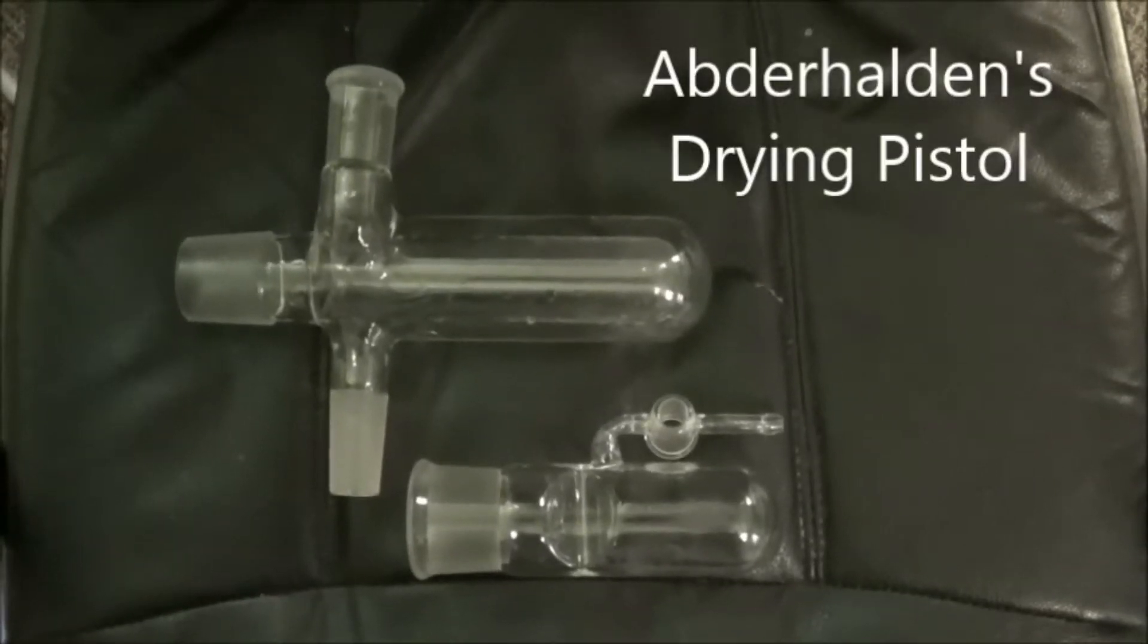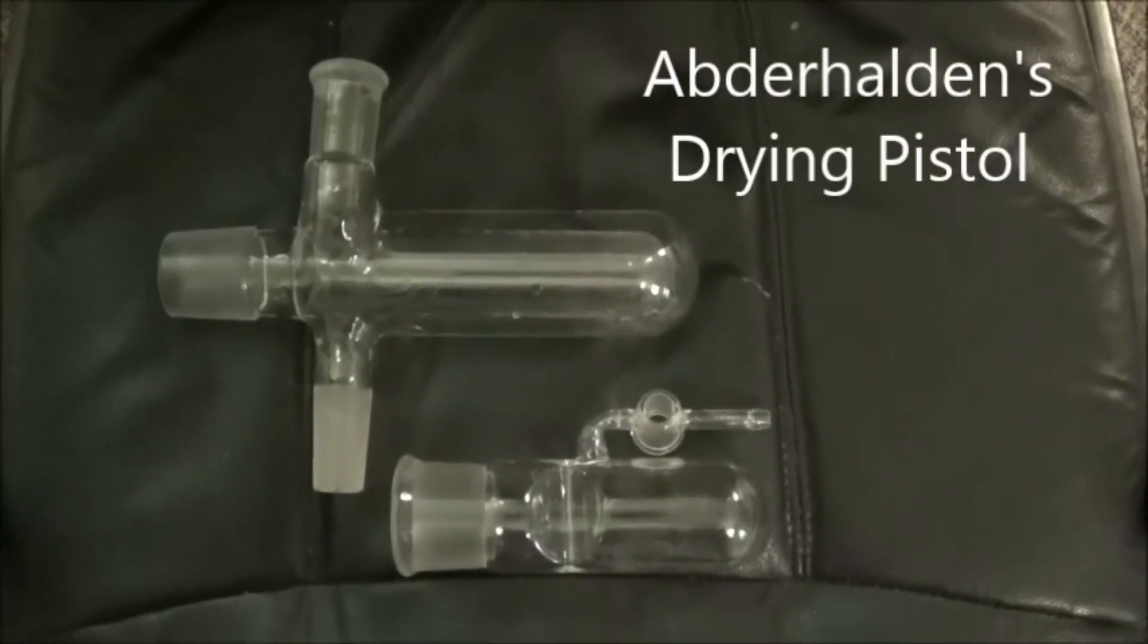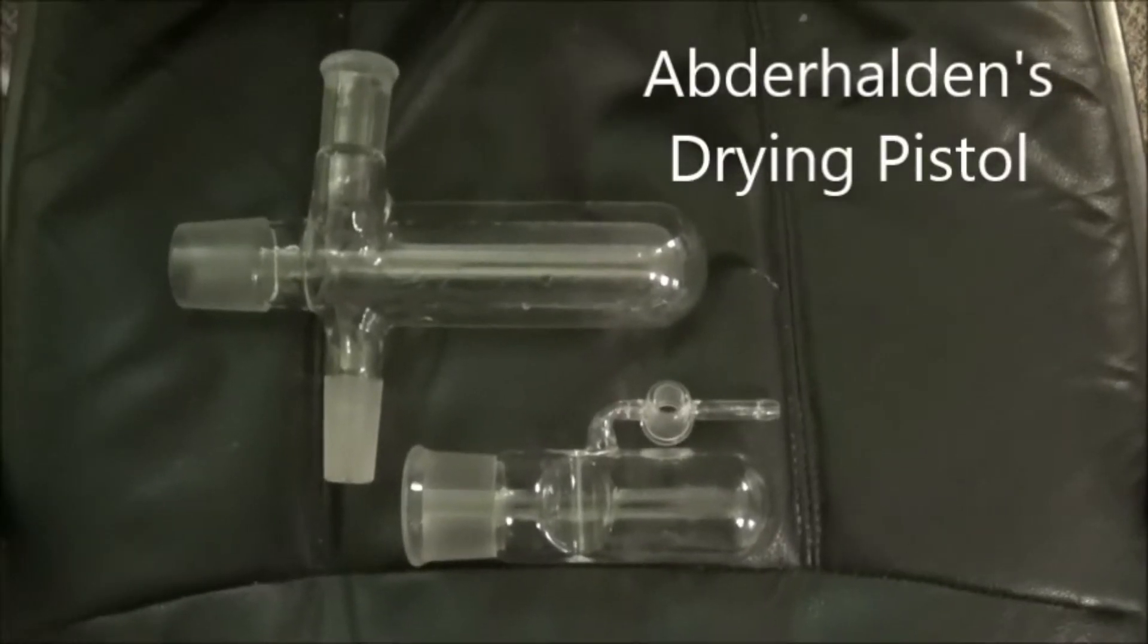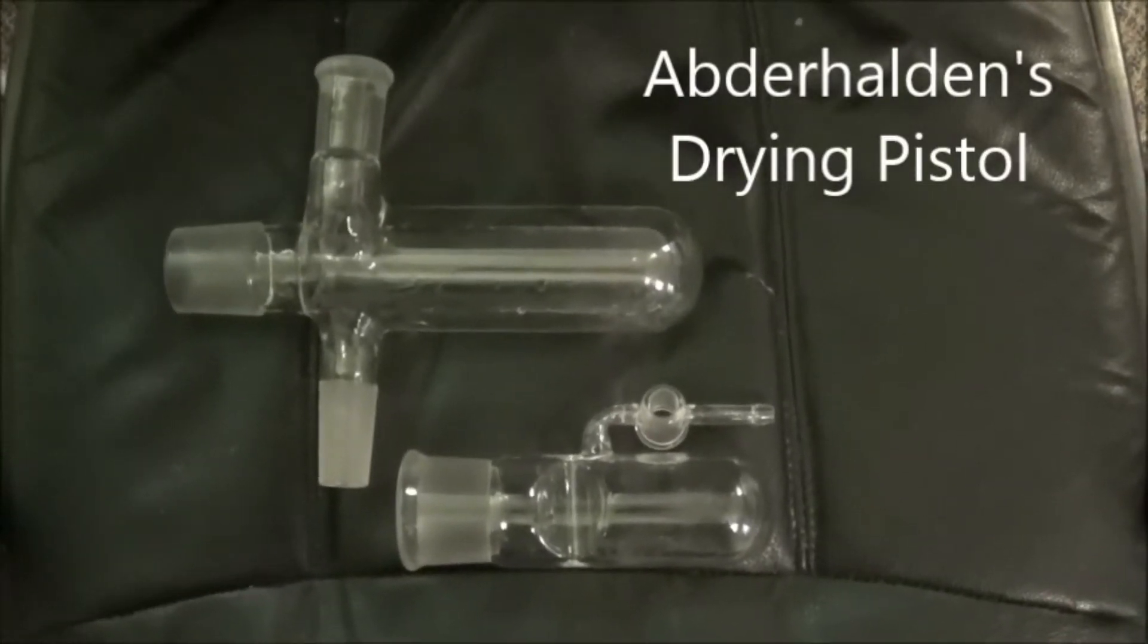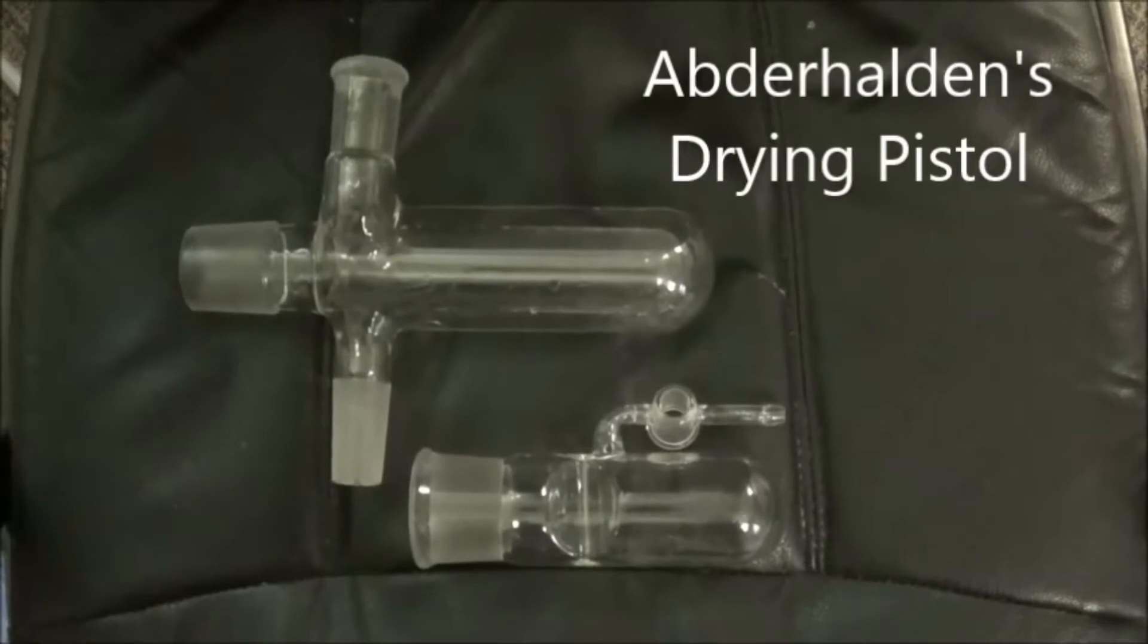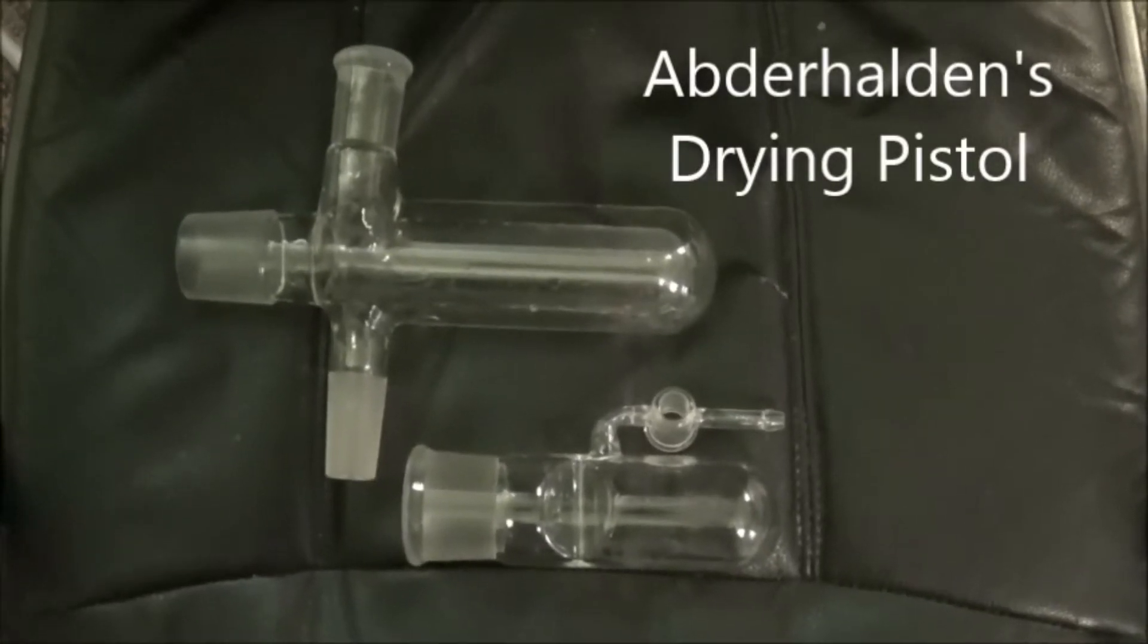Hello everyone and welcome back to the lab. In this video I'll be showing the use of Abderhalden's drying pistol, a piece of glassware that is similar to but has many distinct differences from a vacuum desiccator.